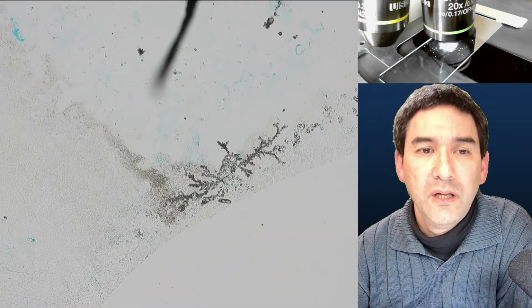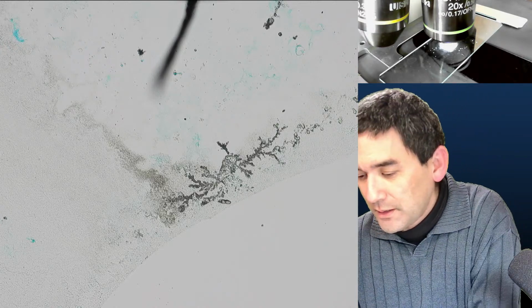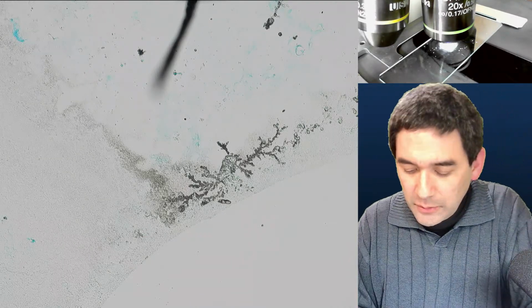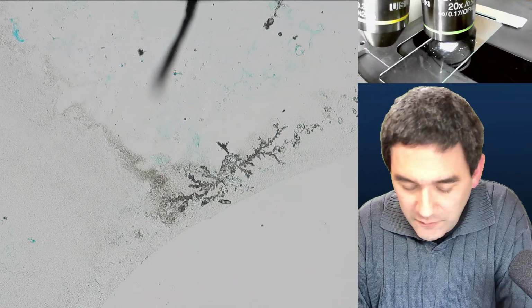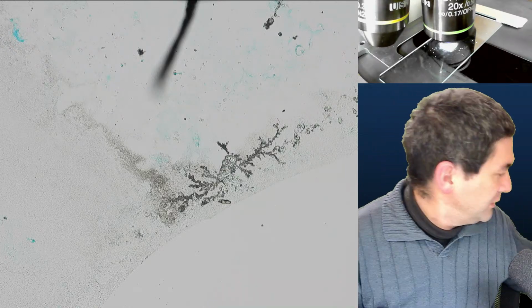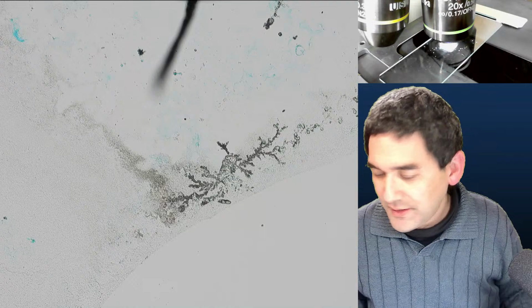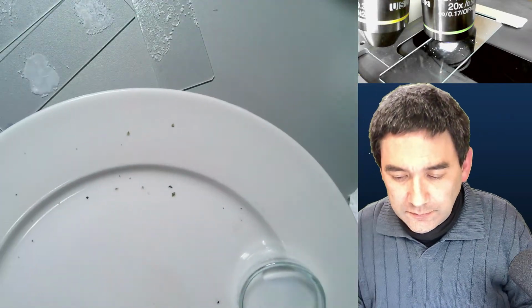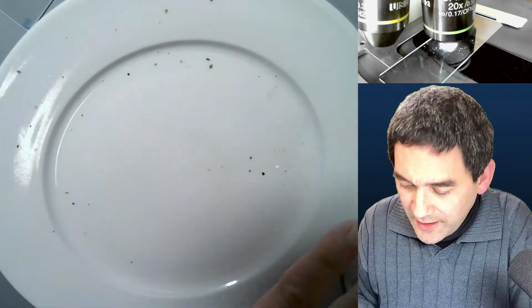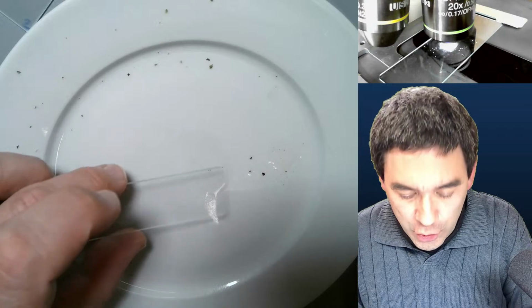Interesting. Okay, so what I'd like to do now is show you a little something different, because that was now all of the 10 samples. I would like to demonstrate a very unique way of actually making crystals, and that is by using a match. Just a second, I need to get my plate again. So here we go. I need to twist the camera a little bit, because I do not want the fire to go into the camera. I'm going to show you crystallization by sublimation, as it's called.